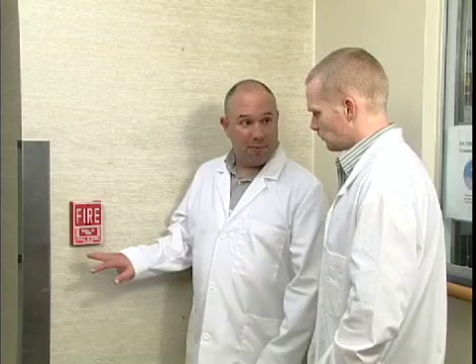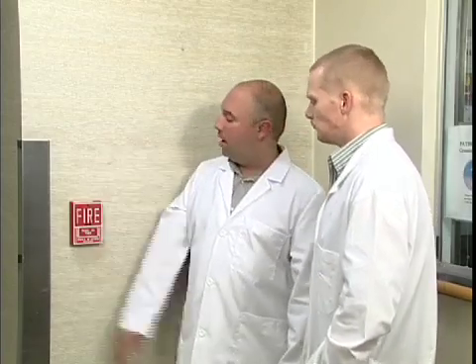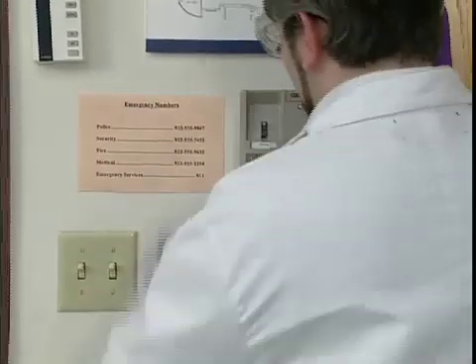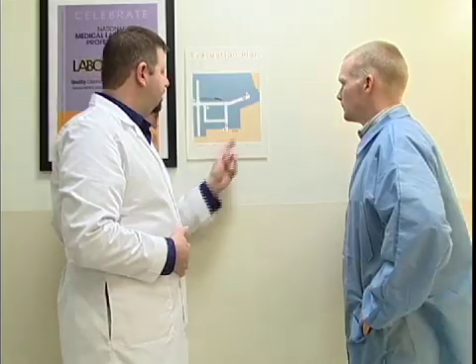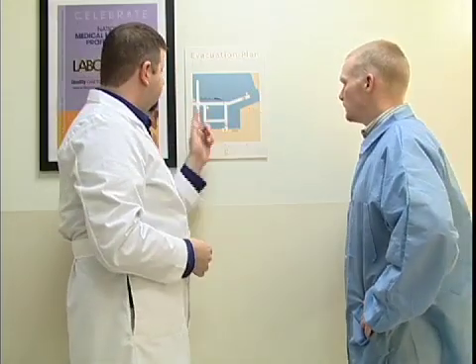There are lots of things we need to be able to do if an emergency occurs. We need to know how to activate alarms and have to be able to distinguish between the signals for each type of emergency if we hear an alarm ourselves. We should know what to do to alert emergency personnel if we need their help. And we have to be fully aware of the evacuation routes for our work areas, as well as designated safe areas where personnel are to assemble after they evacuate.